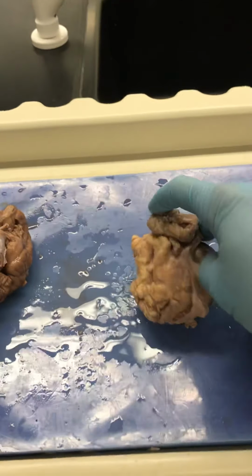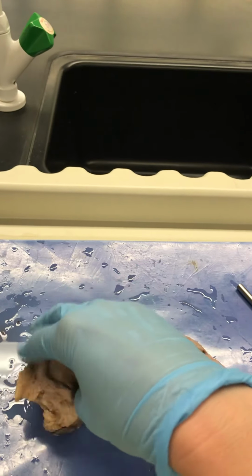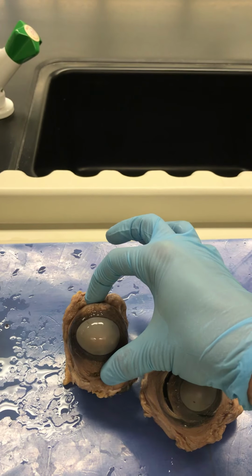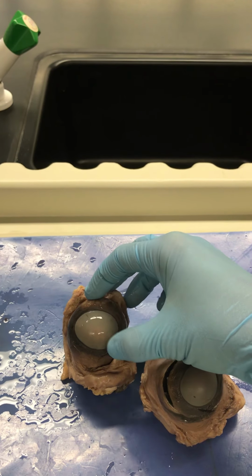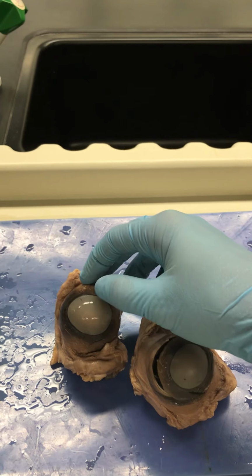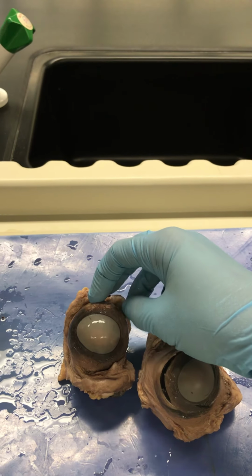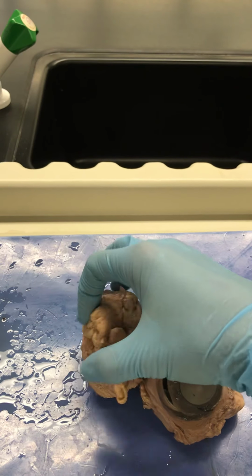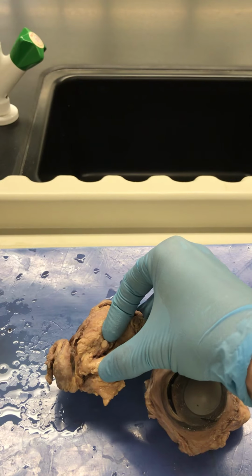And then there's also adipose tissue. There's fat that helps to cushion the eyeball in the skull, the orbits, sockets of that cow eye and your eye. All right, so the eye is a very incredible part of the nervous system. It is a sensory organ that is devoted to vision. And so we have that cornea here, and then we have the sclera, the muscles and the adipose tissue, and then the optic nerve coming out back here.